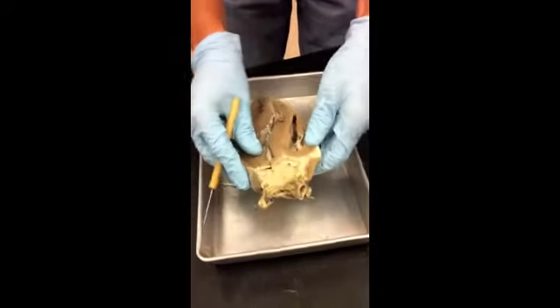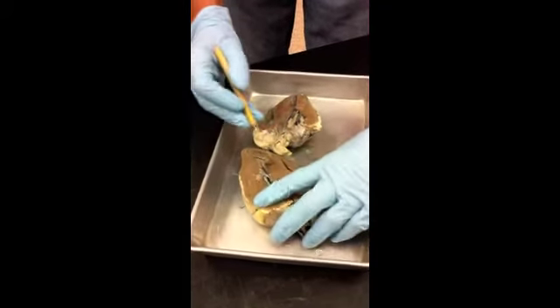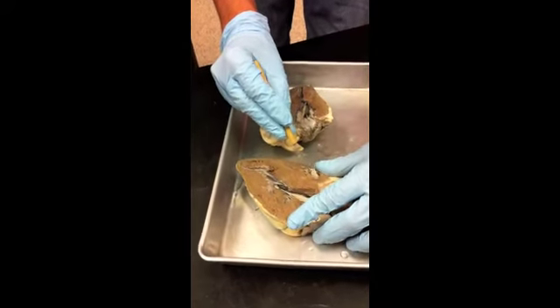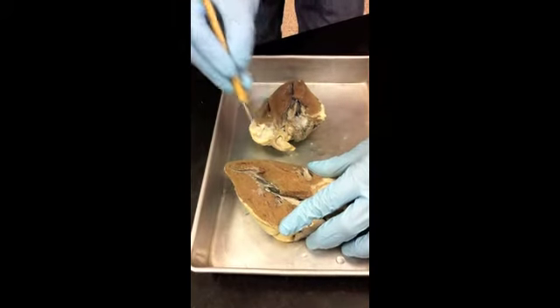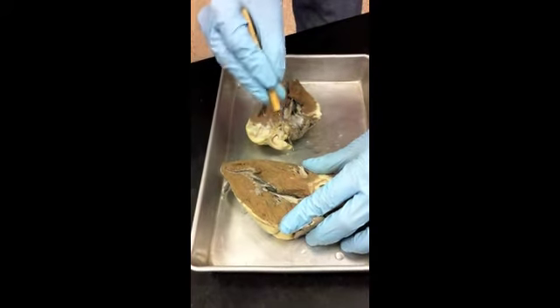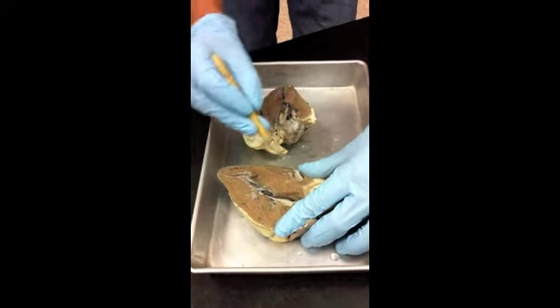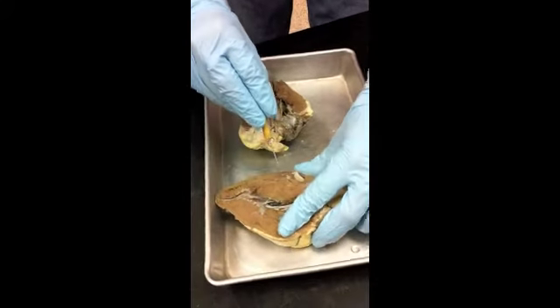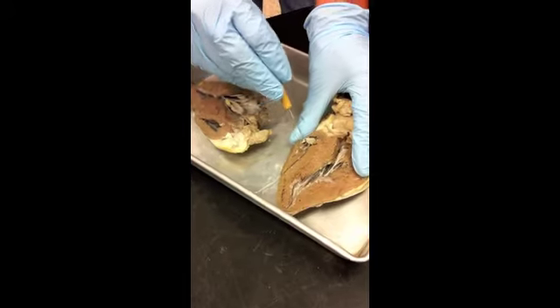Let's look at this one. Actually, that's a really good example of a papillary muscle right there. So this is the right side, right? That means this valve is going to be what? The tricuspid valve, or the right atrioventricular valve, because it's a valve that goes in between the atrium and the ventricle. And these little chordae tendineae coming off of there are all converging, attaching to this papillary muscle. This is actually a cross-section through a papillary muscle right there.